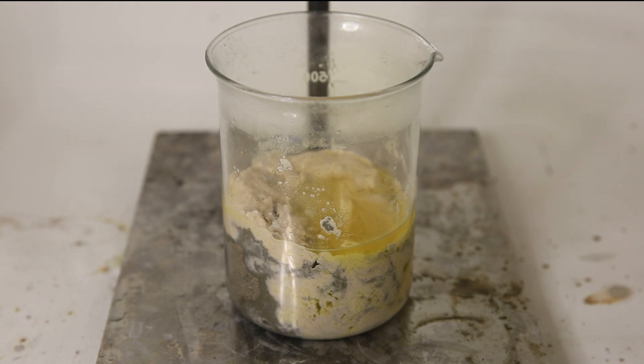To make sure everything reacts and dissolves, I help it a bit by adding a bit of water and stirring it around.